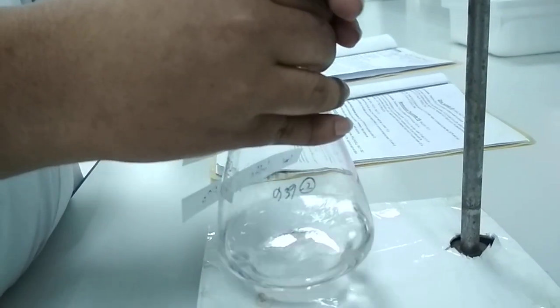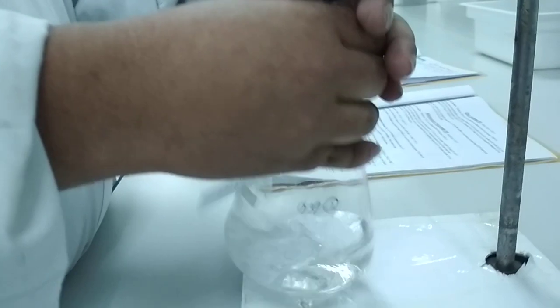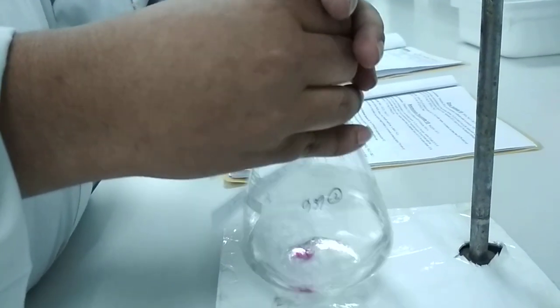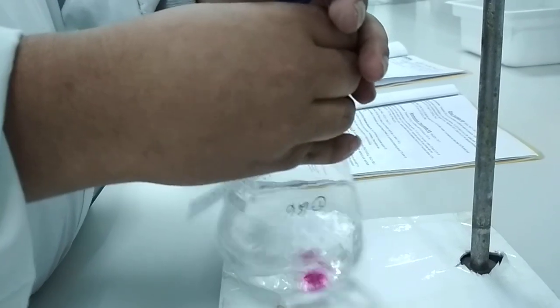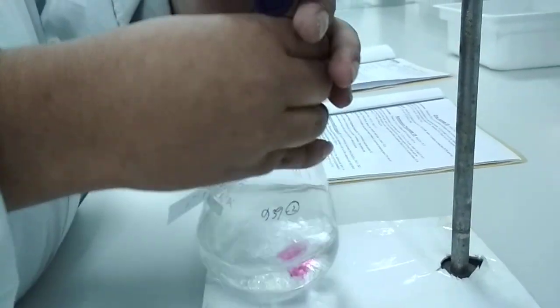No, we should not do this. Yeah, I know, you should follow the... There are lots of do's and don'ts. Do we follow them? Yes. Why not? We do sometimes, but when it is a matter where we can skip it, we will skip. It's a procedure, isn't it?